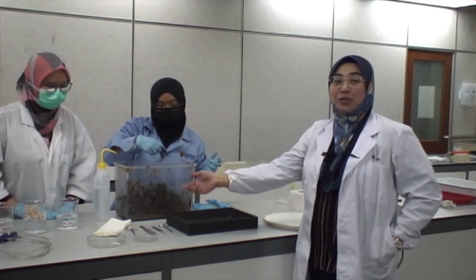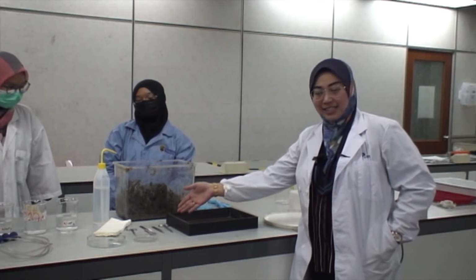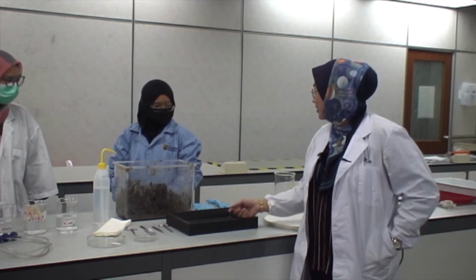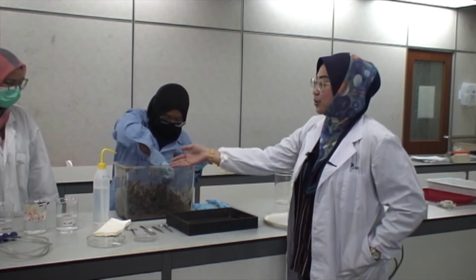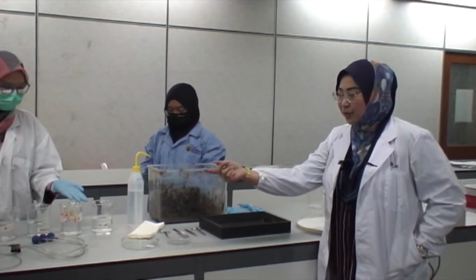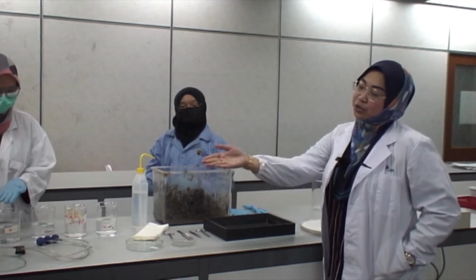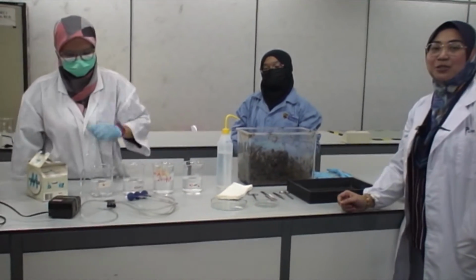Okay guys, so these are the materials that we are going to use for today's practical. Here we have the rubber dish, the petri dish and the dissecting set. And here is the live specimen that we are going to use, which is the peanut worm, as you can see. We also have tissue, distilled water and four levels of salinity of water: 0, 10, 20 and 40 ppt. And here we also have the aeration pump, the aeration tube and the aeration stone.